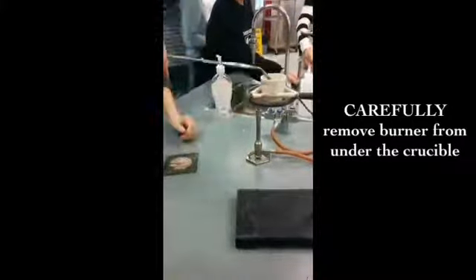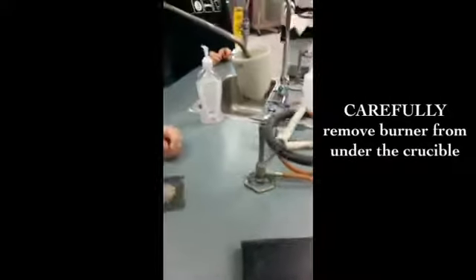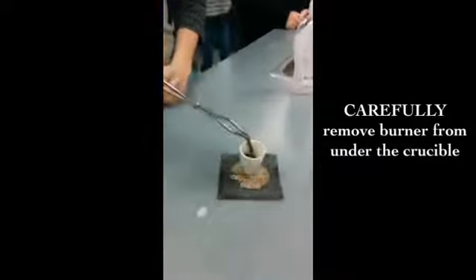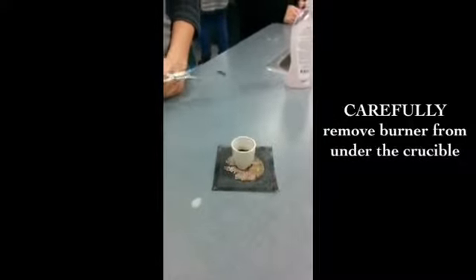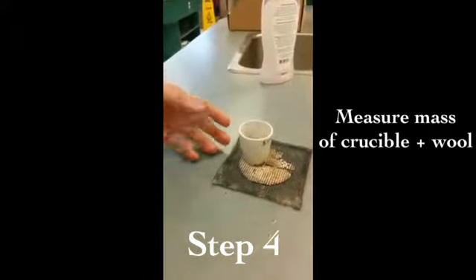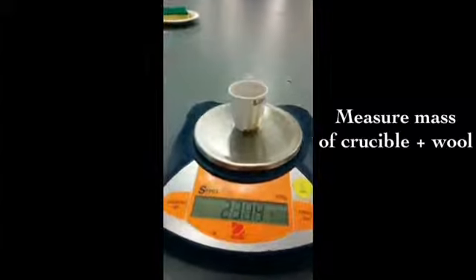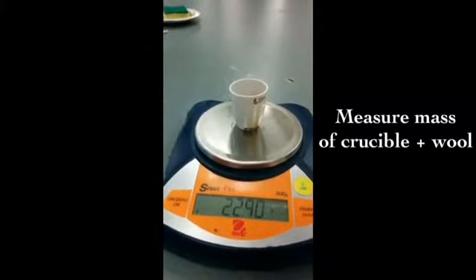Now, the apparatus is still going to be hot, so be really careful and use tongs to remove the crucible and place it on the cooling rack. Now that the crucible is all cooled off, let's find the mass of the crucible and its contents. 22.90 grams.